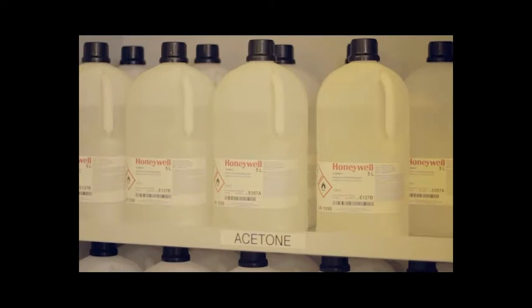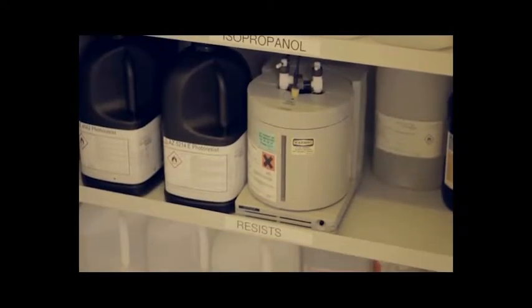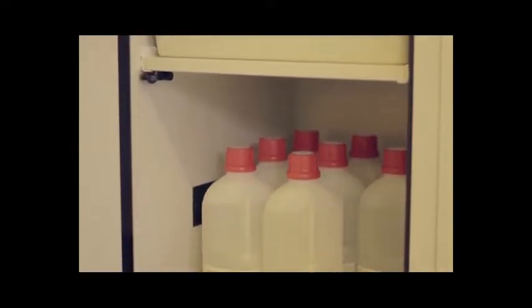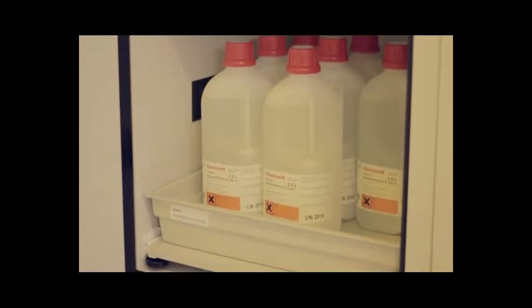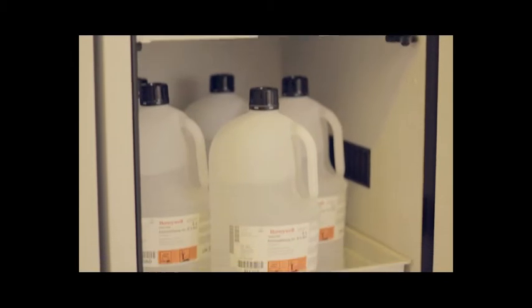The common chemicals needed in processing work are ultra clean, of VLSI or ULSI quality, and purchased and stored by Nanofab. Standard solvents include acetone, isopropanol, and some photoresists. Standard acids and bases include hydrofluoric acid, hydrogen peroxide, hydrochloric acid, ammonium fluoride, sulfuric acid, nitric acid, and ammonia.